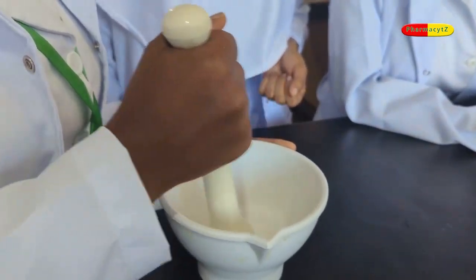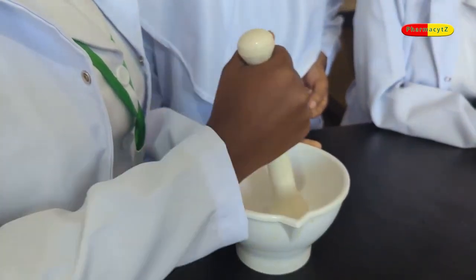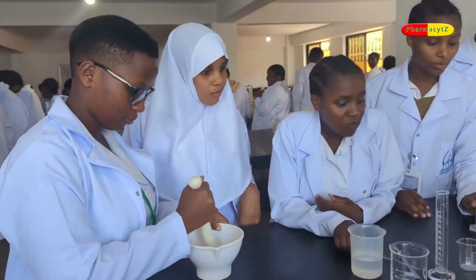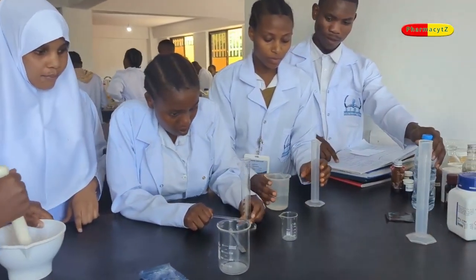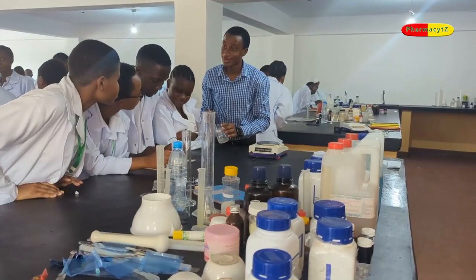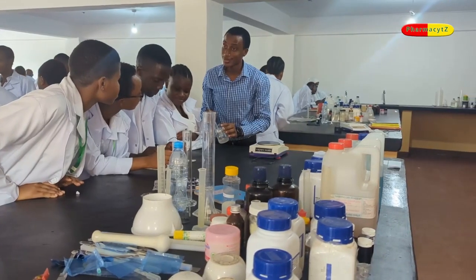Now, before preparing benzoic acid solution, you should be aware of the following. 1. Benzoic acid poorly dissolves in water. It is easily stated as benzoic acid slightly dissolves in water. So what do you do to increase its solubility? You should know that it dissolves well in organic solvents such as alcohols, chloroform, ether, and benzene itself.